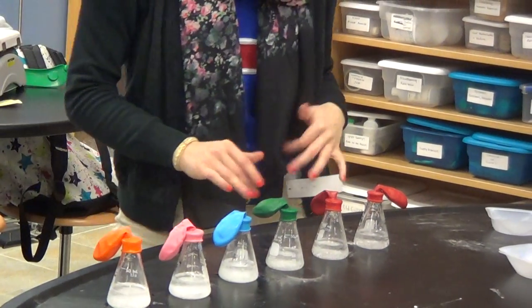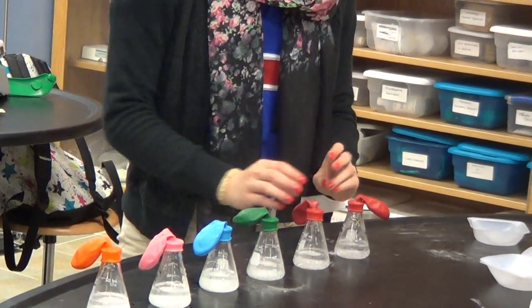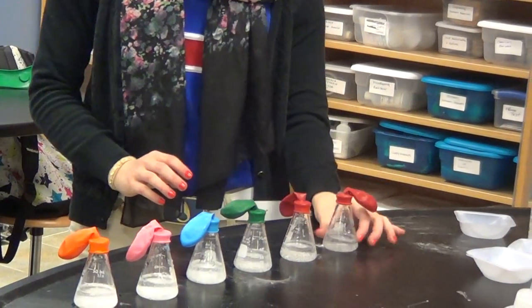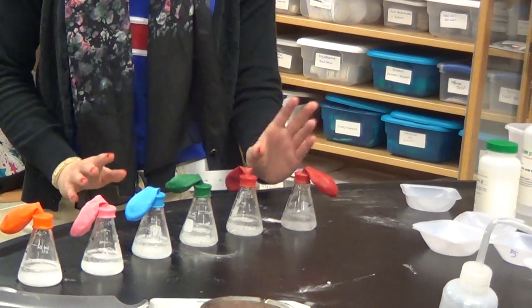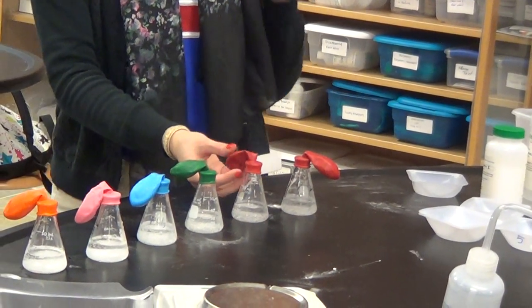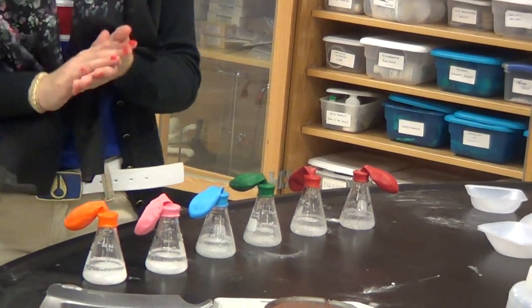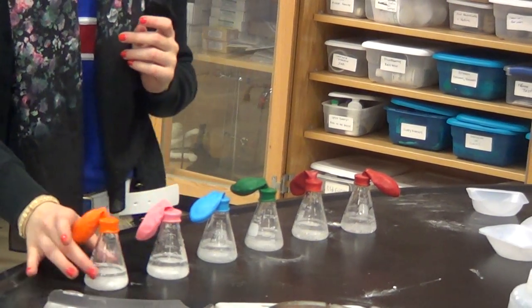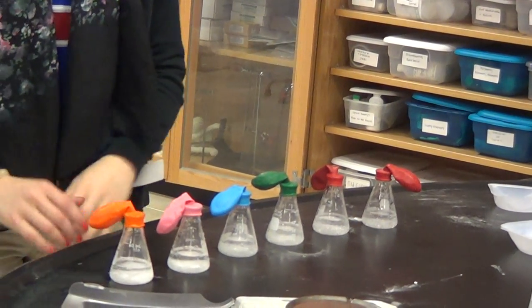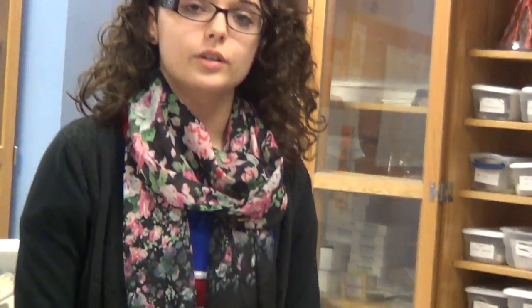As you can see, the balloons are starting to rise. This one has eventually finished reacting, so it's going to stay the same, but the others are getting harder and bigger, showing that the reaction is working better with the increased sodium bicarbonate.